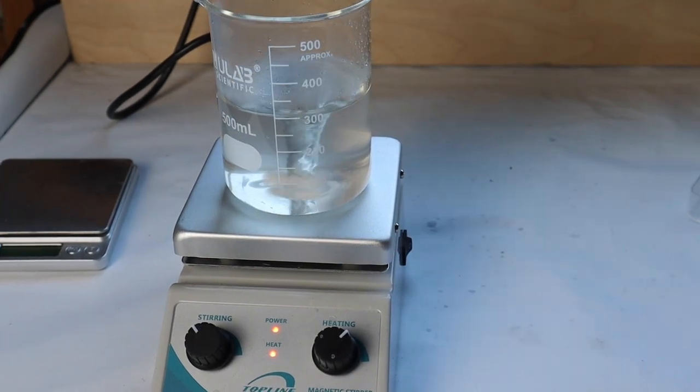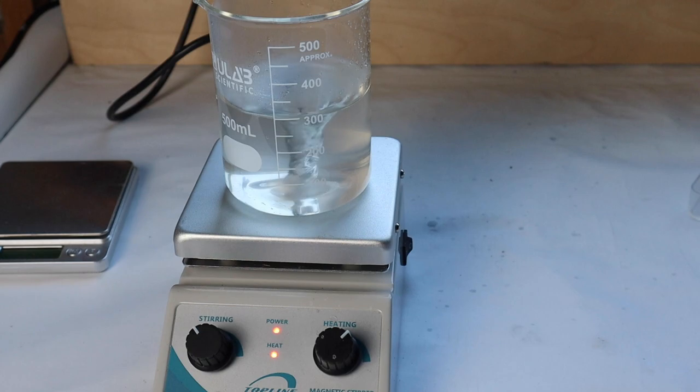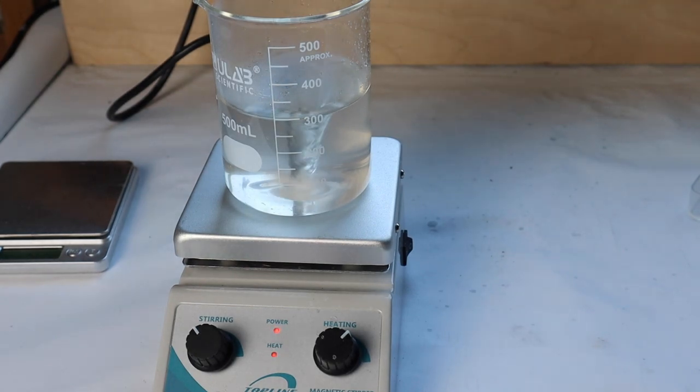Now I wait. We're about 15 minutes in and it looks pretty much the same. It's slightly more cloudy I think, which is to be expected because the solubility of calcium acetate actually goes down with heat.